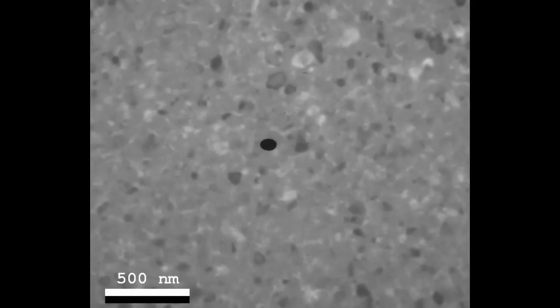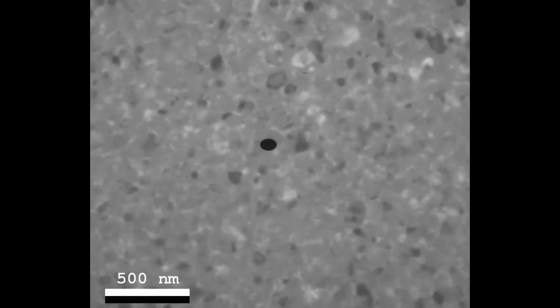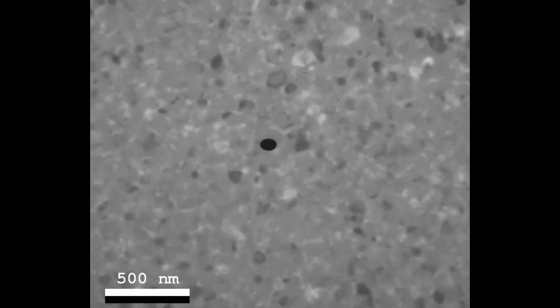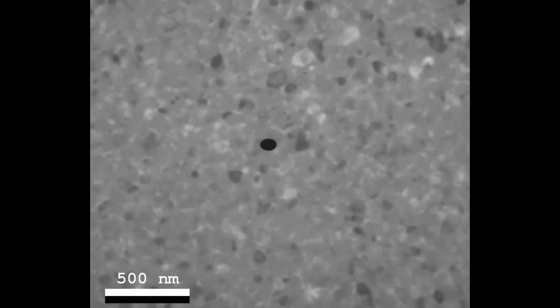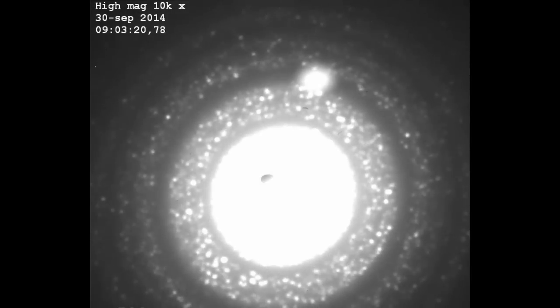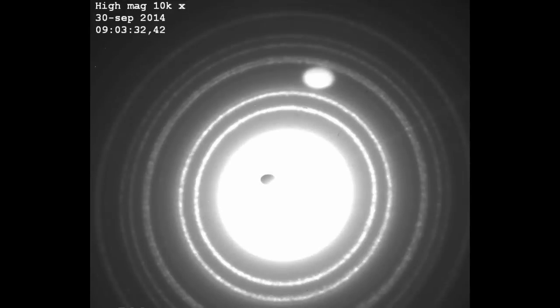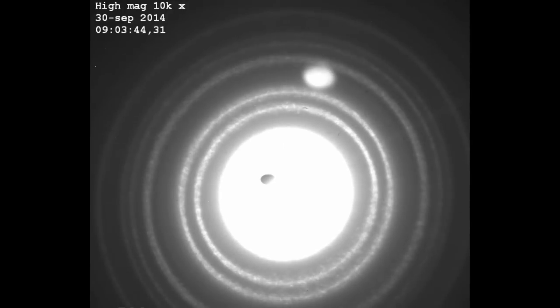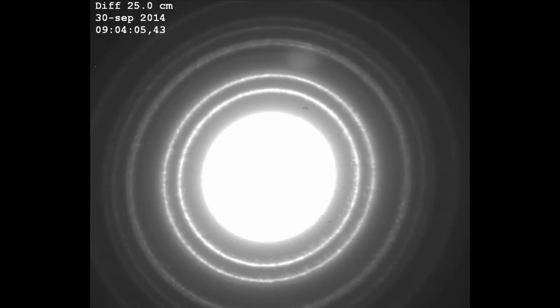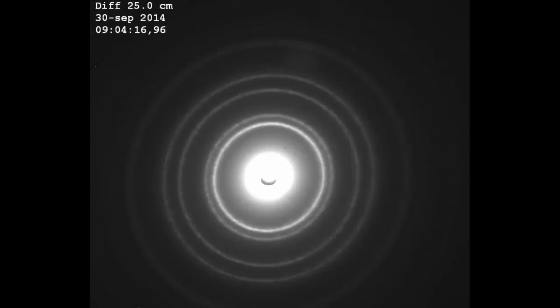You can see that the whole surface is covered by small grains — and that is correct. When you sputter aluminum, you get a surface that looks like this. What we have here is a large number of small aluminum crystals oriented in completely random directions. We're going to do electron diffraction on this sample now. Here we can see the electron diffraction of the sputtered aluminum. The pattern shows several concentric rings, and these rings are created because we have a tremendous number of crystals contributing to the diffraction pattern. If you stack all these patterns on top of each other in random directions, they create these rings.